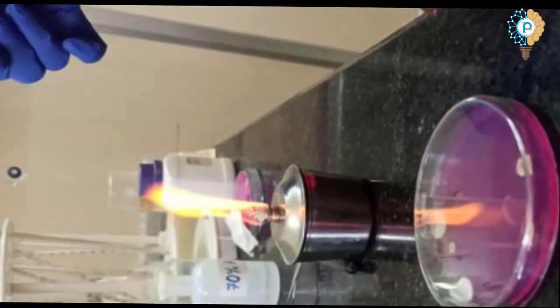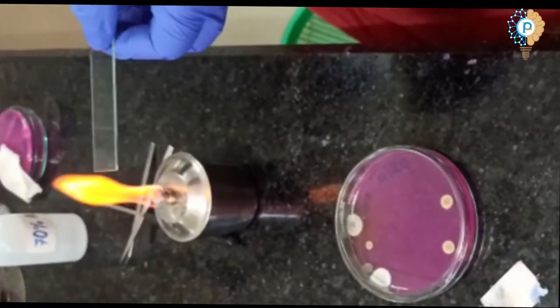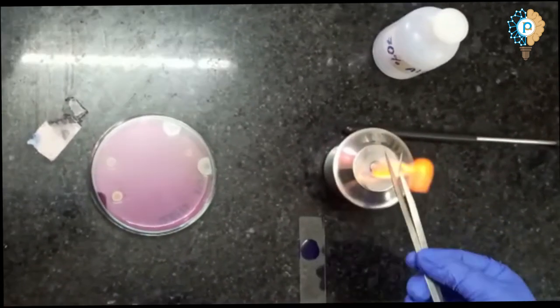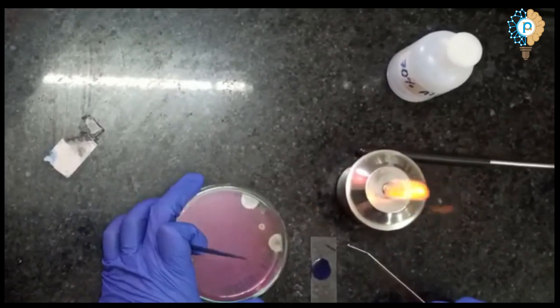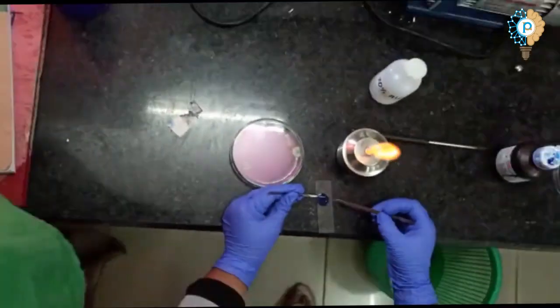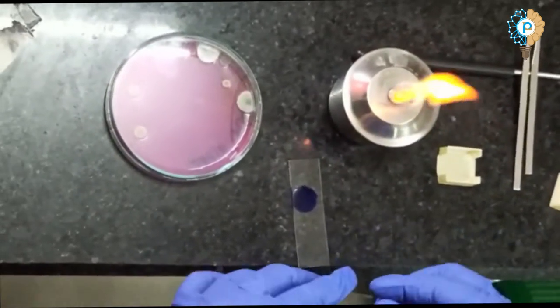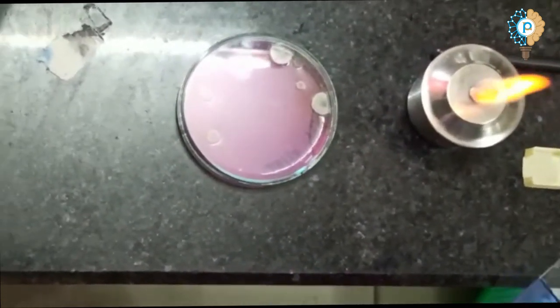Now I am going to describe the step-by-step procedure for fungal staining. First, we have to take a clean glass slide. Then we have to add one to two drops of Lacto Phenol Cotton Blue reagent on the clean and dry slide. Then we have to carefully transfer a mycelial mat on the fluid through a sterile needle and press it gently so that the mat easily mixes with the stain. In the next step, we have to carefully spread the fungal mycelia and make a thin preparation. Now place a cover slip on the preparation by avoiding any air bubble, then blot dry the excess stain.